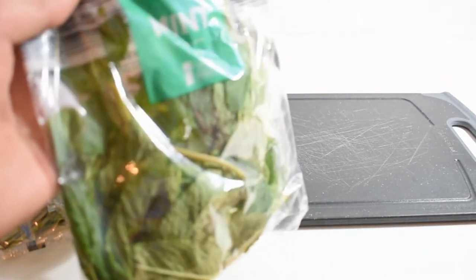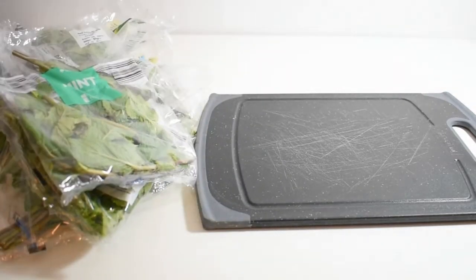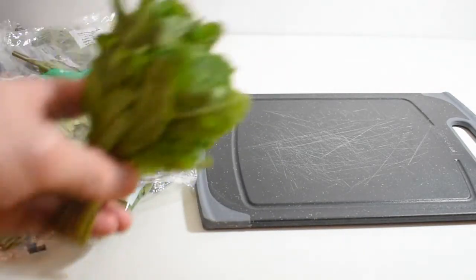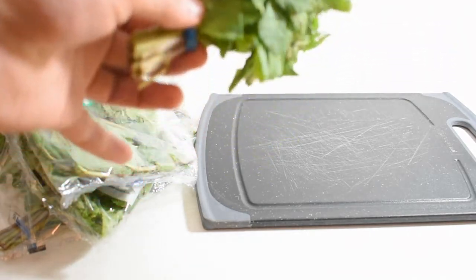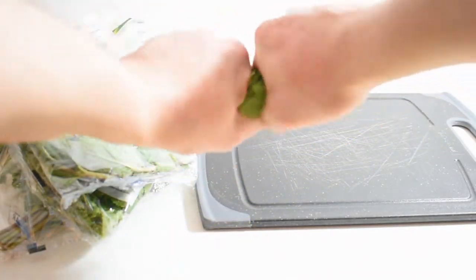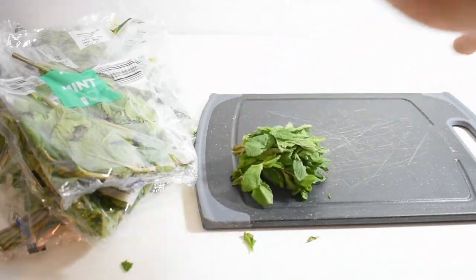These packets are mostly just leaves, but the other packets come in little bunches. To get the leaves off, I can just twist and remove the stems that way.